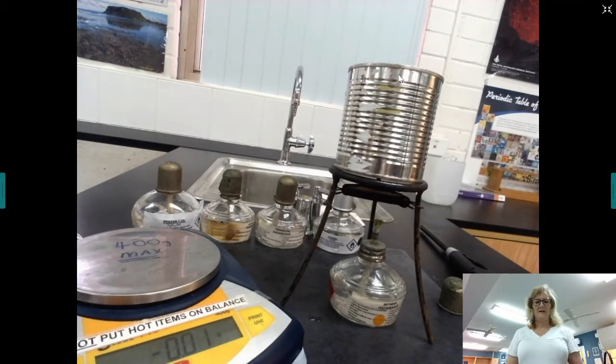Chemistry. Today's demonstration is looking at heat of combustion of alcohols. This is investigation 11.1 on page 318 of your textbook. The textbook actually asks you to design your own procedure, so what I'll be doing is just showing you a procedure that works. Now, we need to do this for a variety of alcohols because the purpose is to compare the heat of combustion of different alcohols.